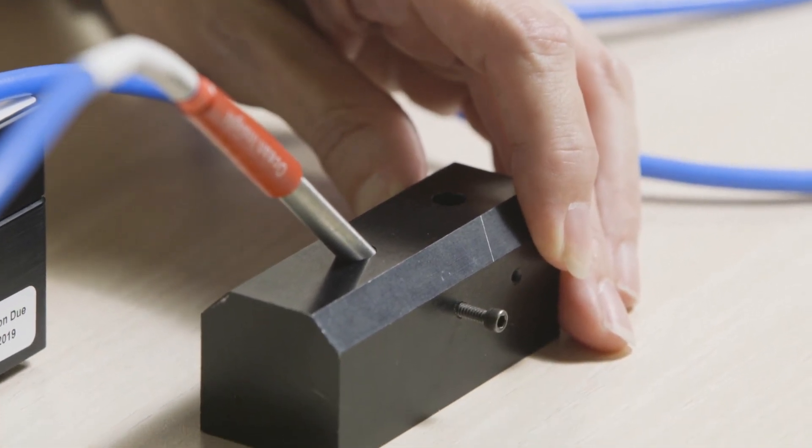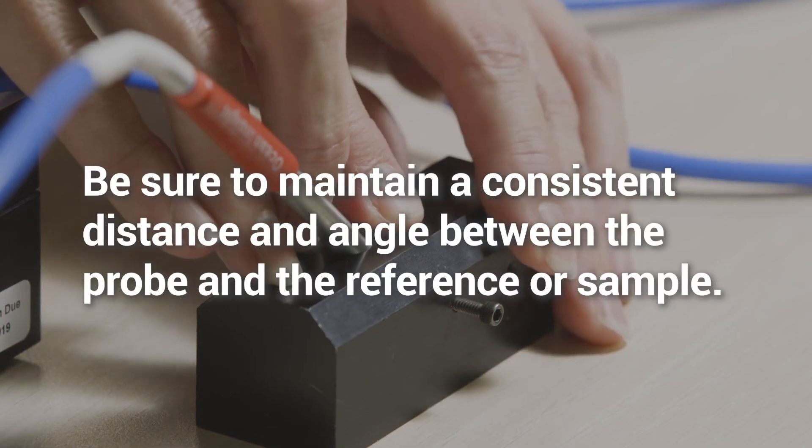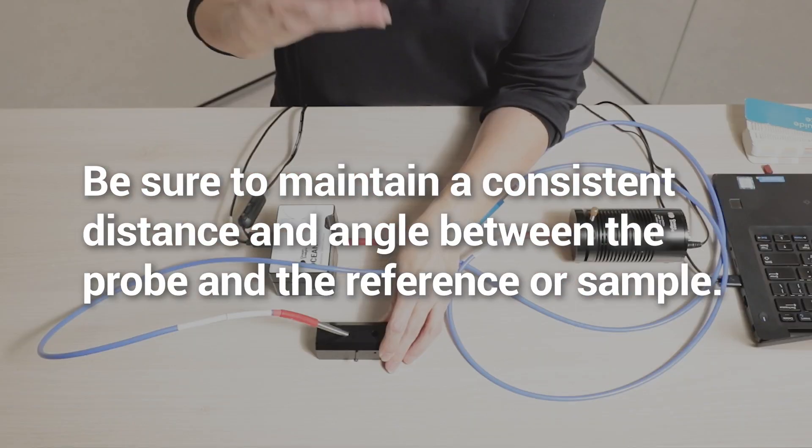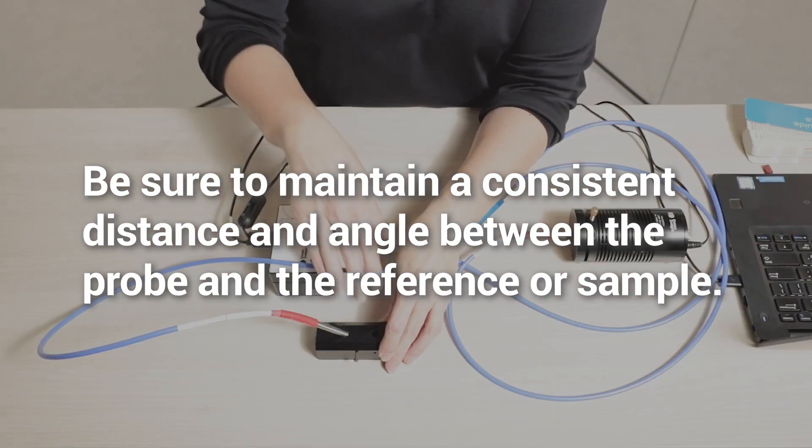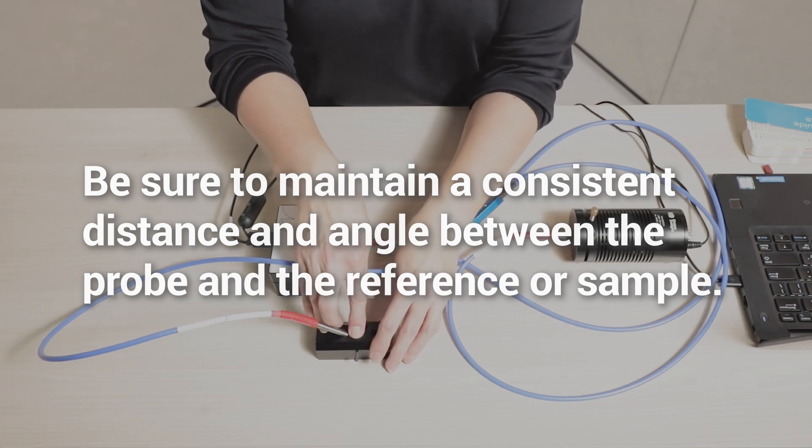You need to make sure that the distance and the angle between your reflection probe and either your reference or your sample remain absolutely consistent throughout your measurements.